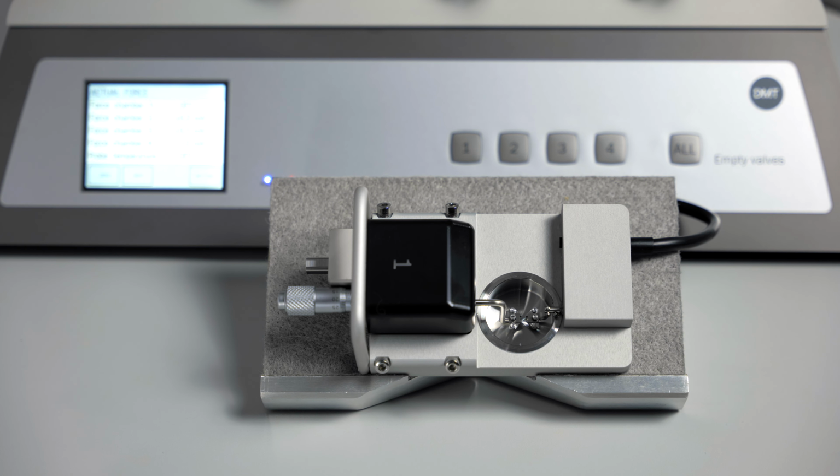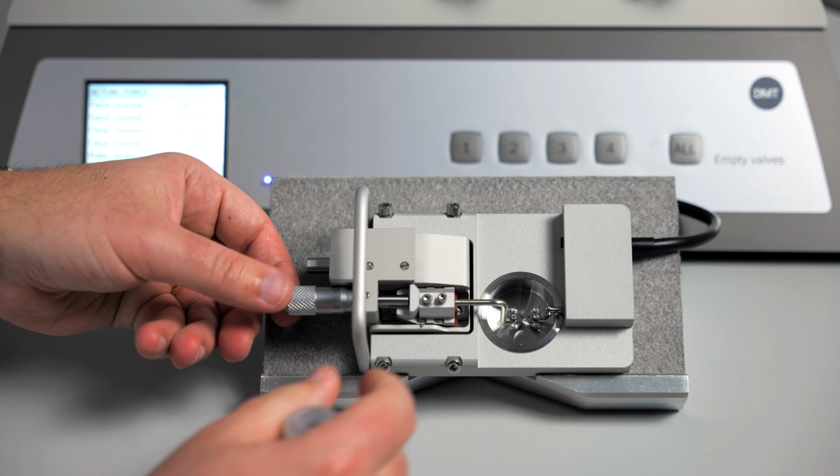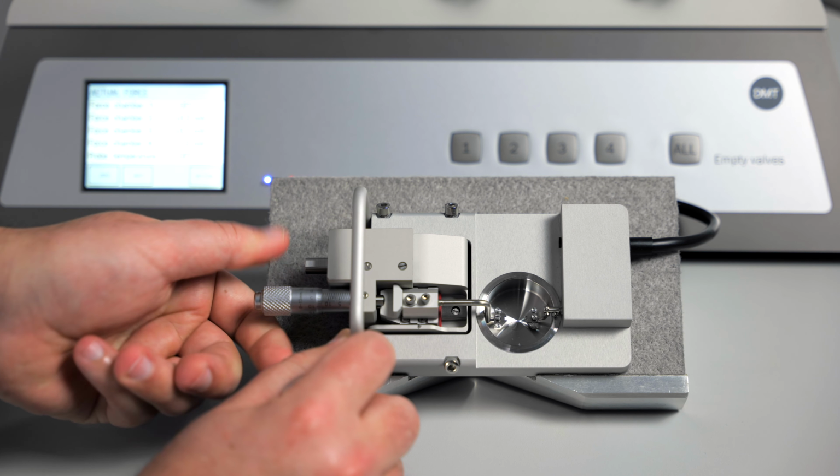Over time and with enough use, you will notice that the micropositioner becomes stiff and it does not move as freely as it used to. You can easily re-grease the micropositioner and get it working like new. To re-grease the micropositioner, back the screw off all of the way.